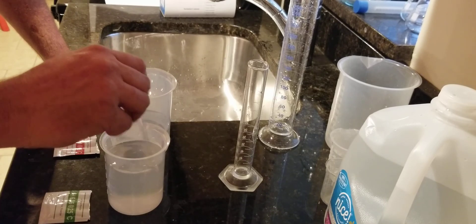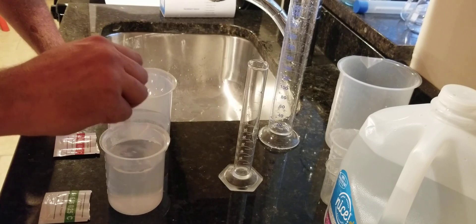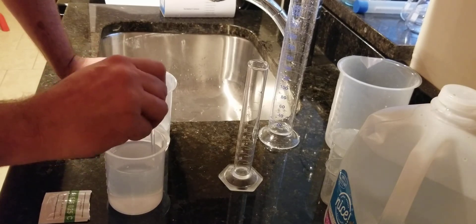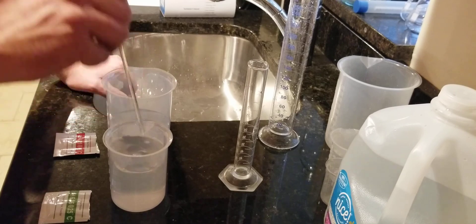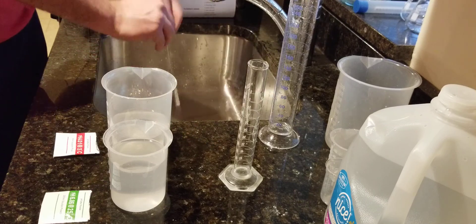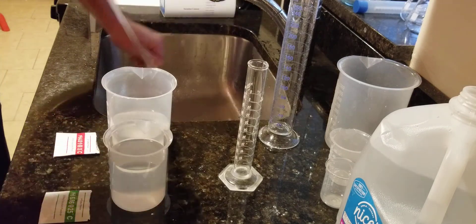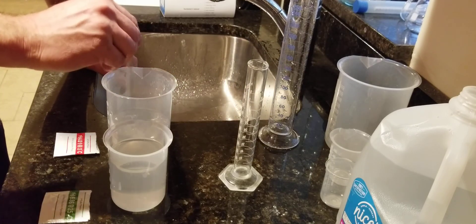It's cheaper just to throw it out and buy a cheap one and use it. I want to make sure to get this good and stirred and that the powder is nicely diluted — there should be no chunks of stuff on the bottom, and if there are, break them up. Make sure to get this properly diluted. Now I'm going to rinse it with regular tap water, using a glass mixing rod. I'll rinse with a pinch of distilled water and move on to the four solution. I always like to keep these in front so I remember which solution is which, because I'm easily distracted.